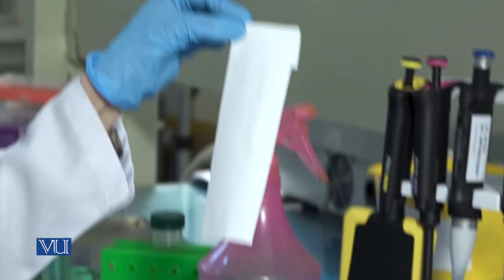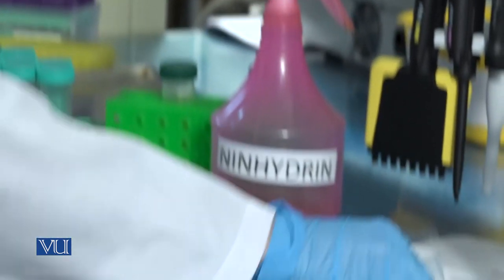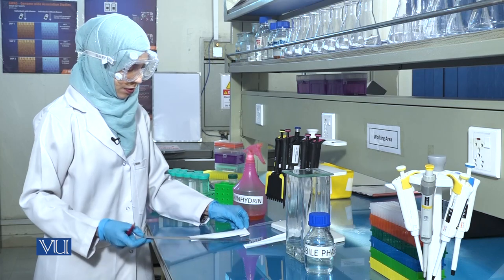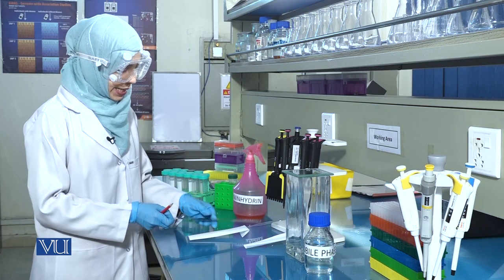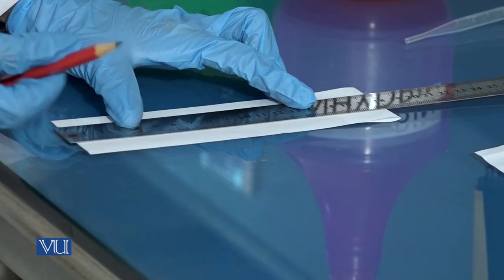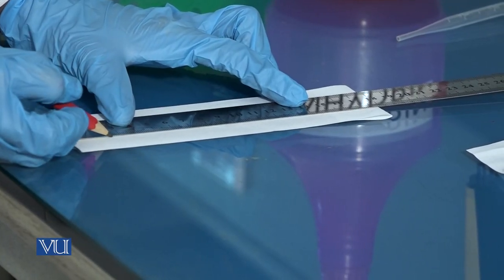Next, take a clean piece of filter paper. Using a lead pencil, draw a line at least 2.5 cm from the base of the filter paper.